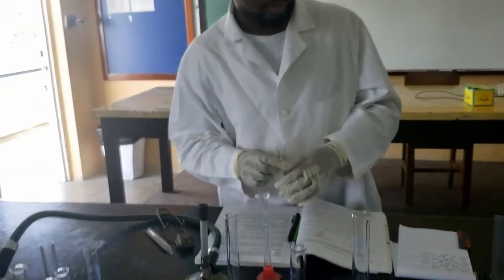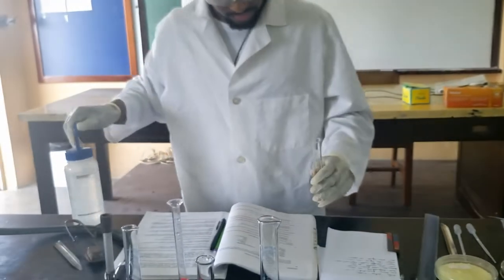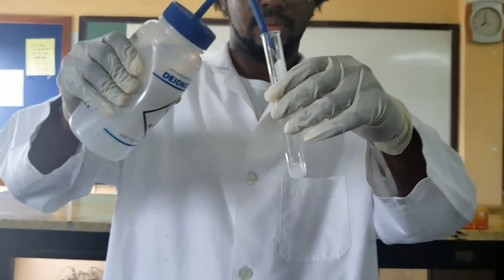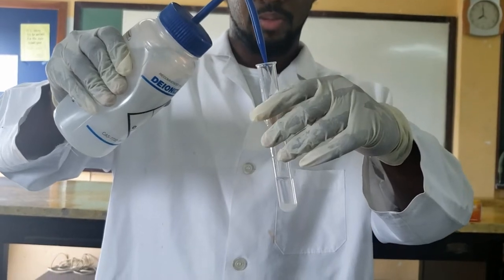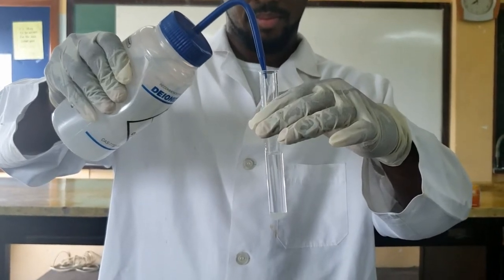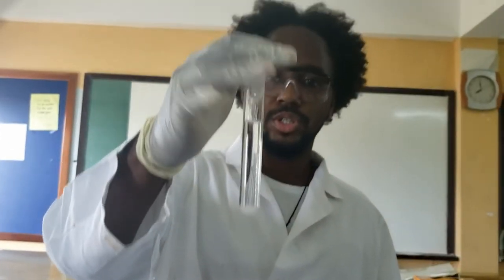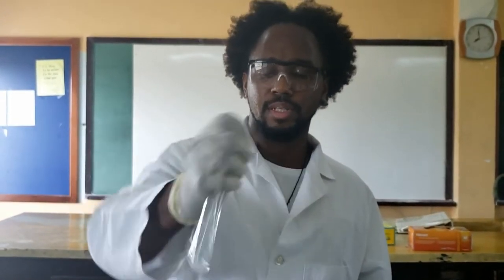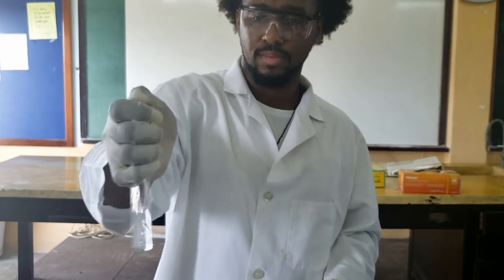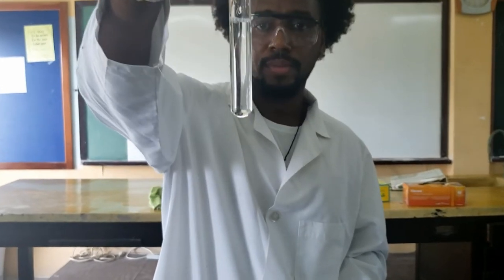Let's deal with the test tube first — the sugar in the test tube. It says to add distilled water to half the tube, so we have our deionized water and we just add some inside the tube. Remember, this is a two-part experiment. For the test tube with sugar, once you've added the water, we invert the mix. And as you've observed, that sugar dissolves.